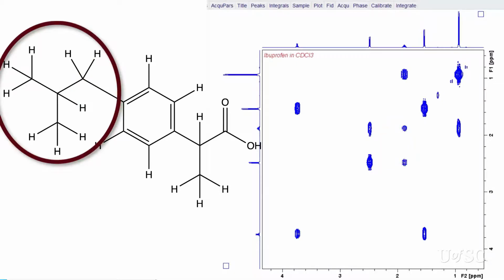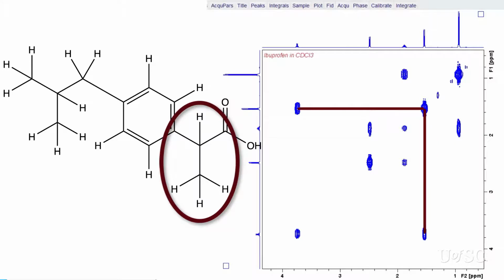These three resonances form a spin system that can be walked through, following the path that starts at the diagonal for the methyl, goes next to the cross peak between the methyl and methine. It goes back to the diagonal at the methine chemical shift, then goes to the cross peak to the methylene resonance. It finishes at the diagonal of the methylene chemical shift. The other spin system is the single correlation between the methyl and methine protons on the other side of the aromatic ring. These connections help determine the chemical shift assignments, which helps to confirm the structure.